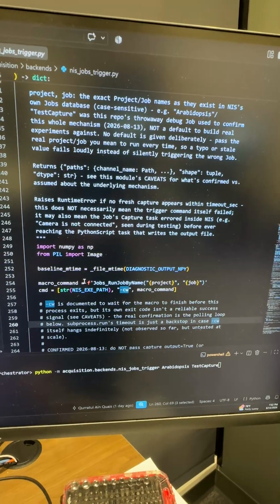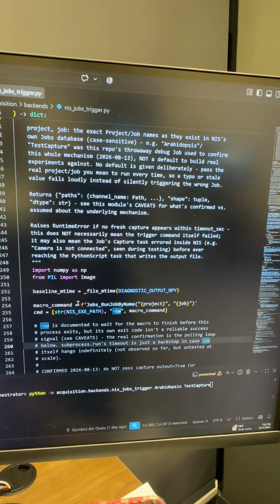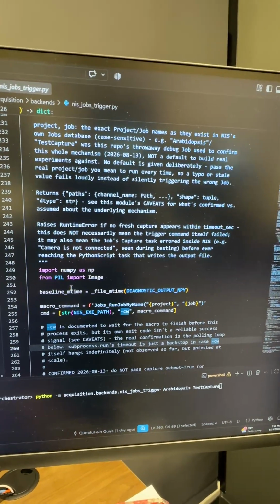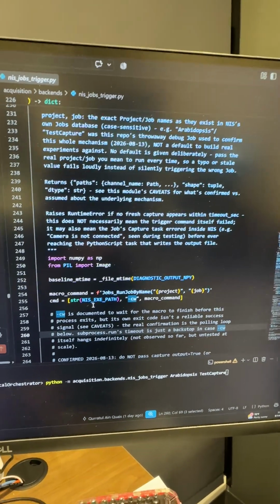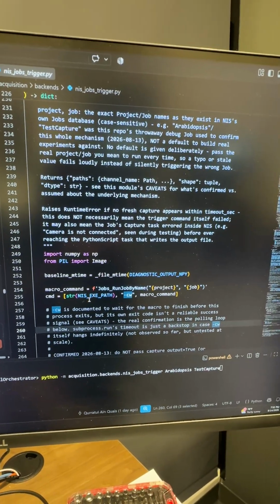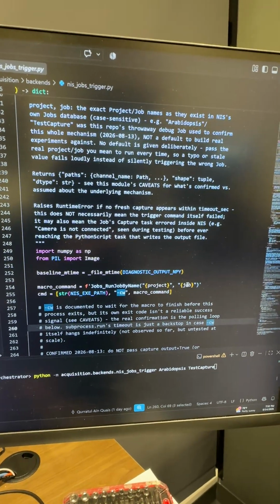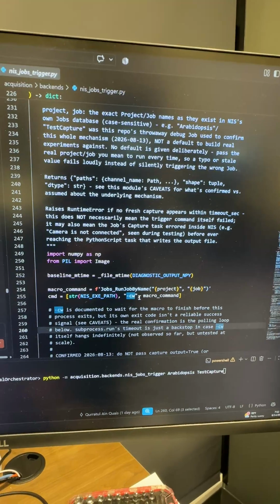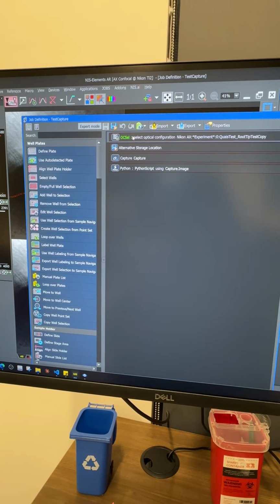So the real challenge was how to trigger the microscope software to run a capture from outside with a script. What I found in the documentation is there is a command line option that lets an external process send a command into the microscope, and we can wait for it to finish. We are passing our job name, test capture, through the job, and using this command line option to call it simply.